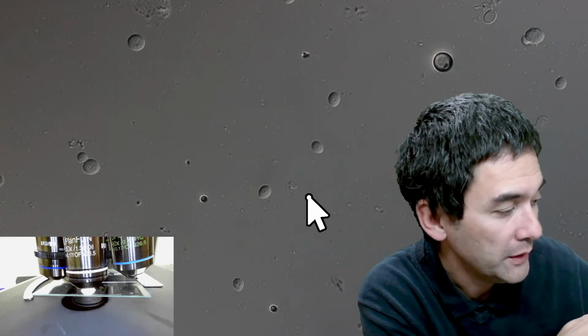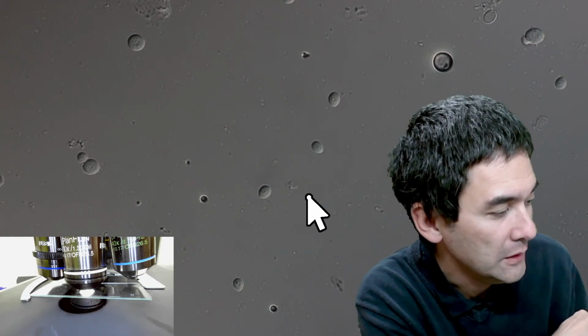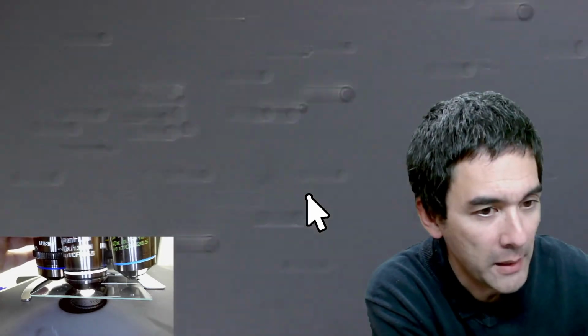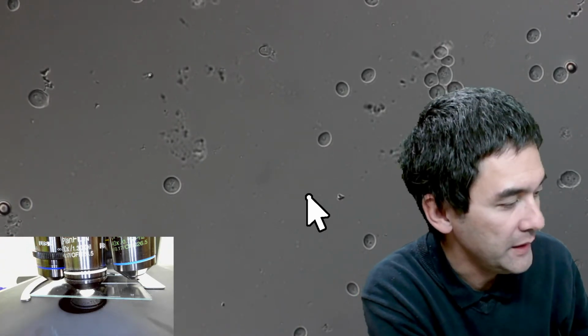And be careful that you don't crash the slide, obviously, into the objective. And to remove the bubbles, what you can do is go back and forth a little bit like this. But I would like to now show you how I clean the whole thing.